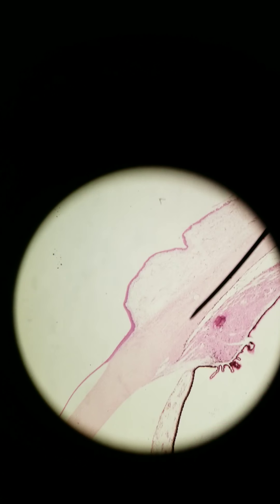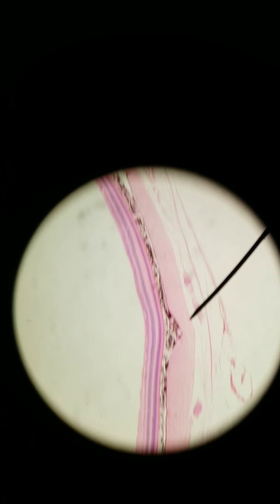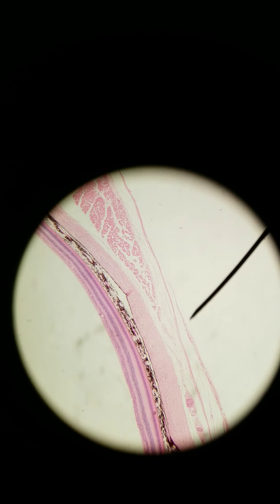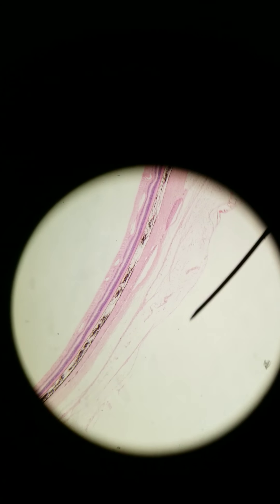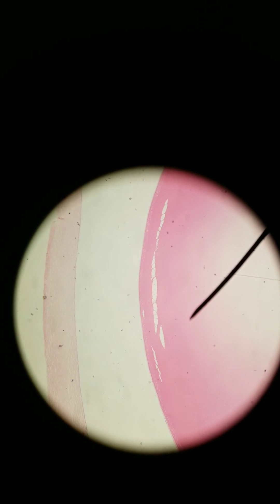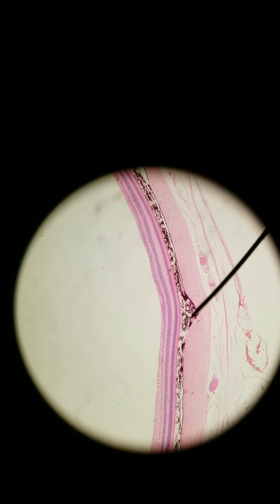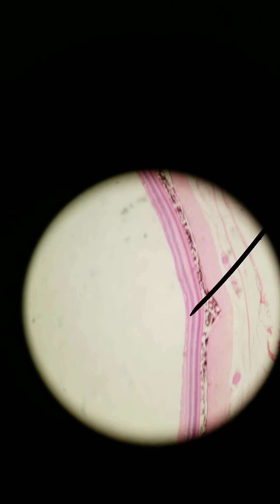This is the anterior side with the lens, all the way to the back. We want to focus on what's in the back as far as histology goes. We'll learn more about the lens and cornea and all that with dissection of an eye. But as far as histology, what I want to be able to recognize is what's back here in the retina. This back layer here is called the retina.